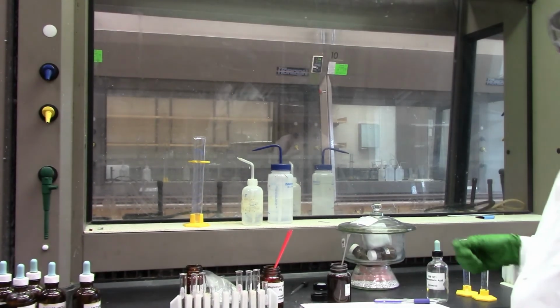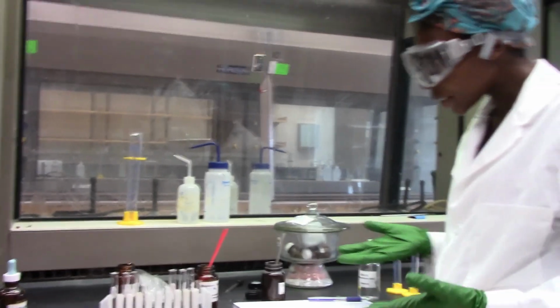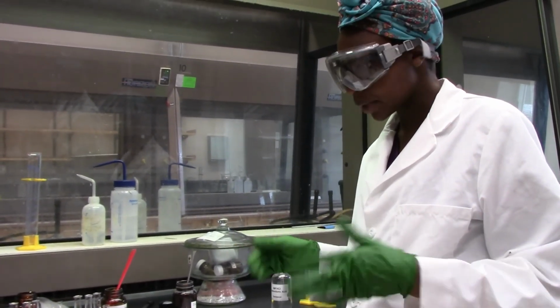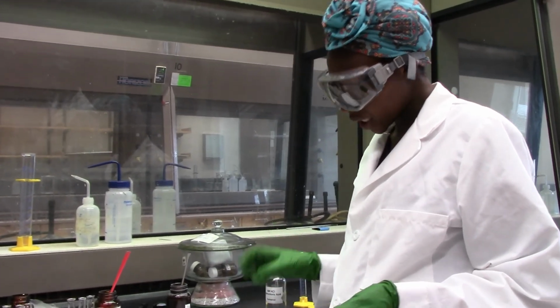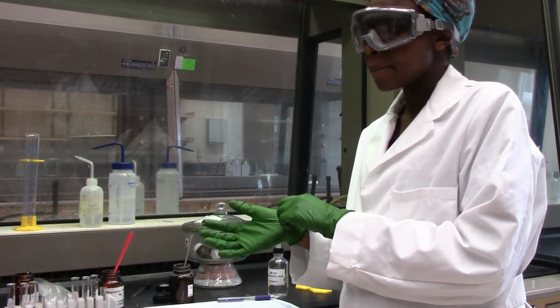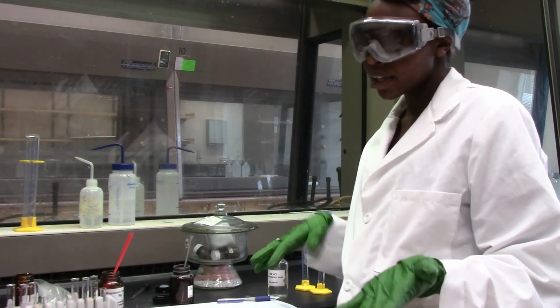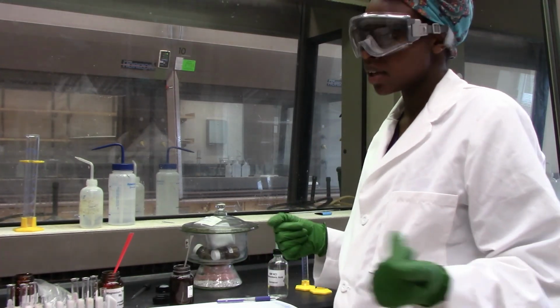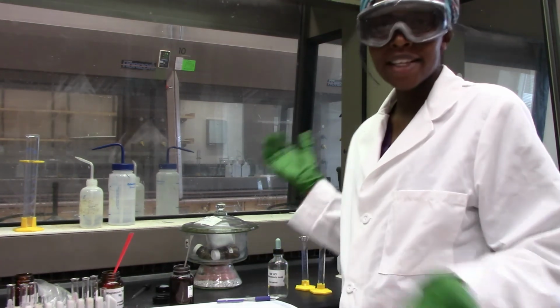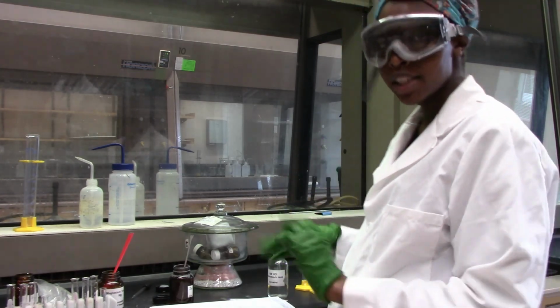Cool. We are done, and now based on the different observations we have made, we will be able to rate which metals are highly reactive compared to the other ones, and then we can look at how these metals are arranged on the periodic table based on their displacing other metal ions or their reactivity with HCl, and for calcium its reactivity with water. So that's it for this experiment, and I hope we will figure out who's more reactive in this activity series.